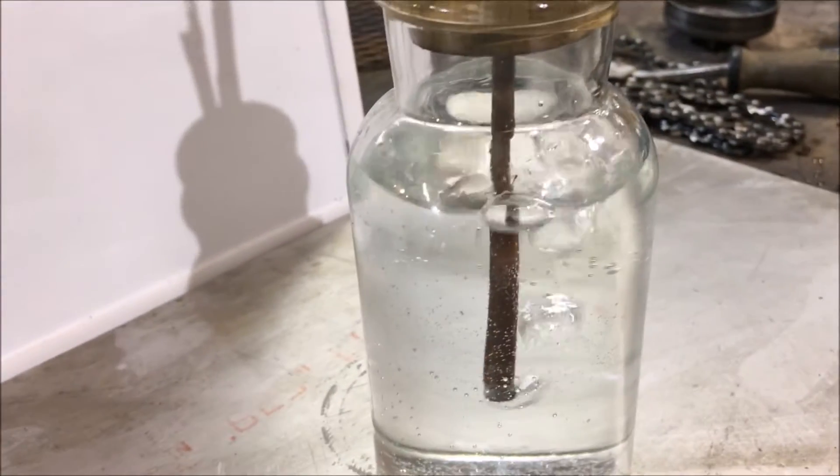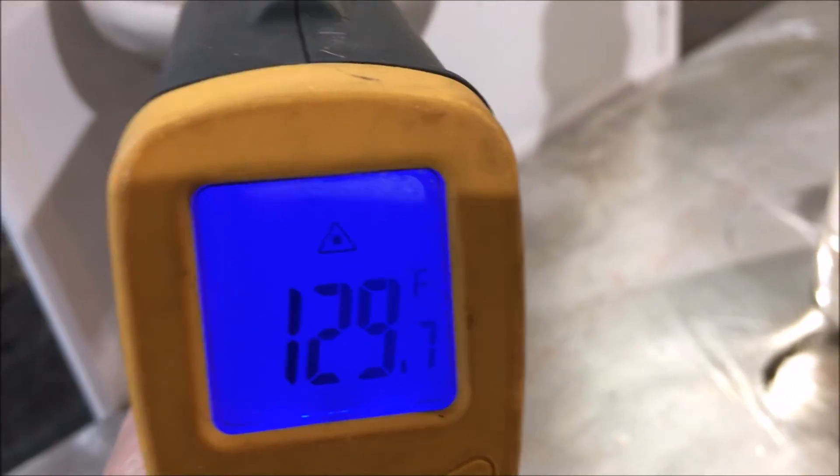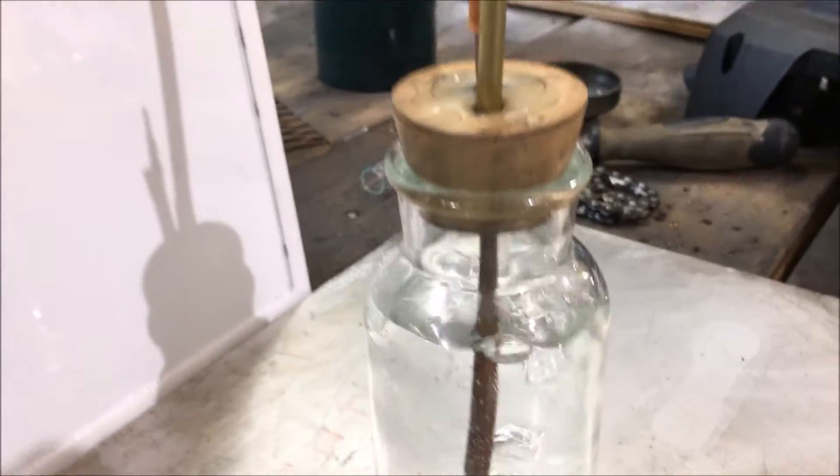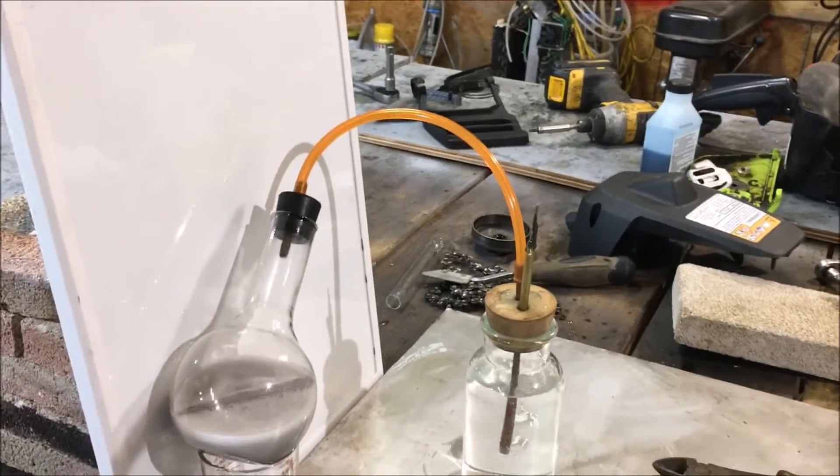At 45 minutes into it, the reaction has really taken off — 129 degrees. I'm going to again light the flare, but I have added a high-velocity nozzle this time. However, it still may explode again.